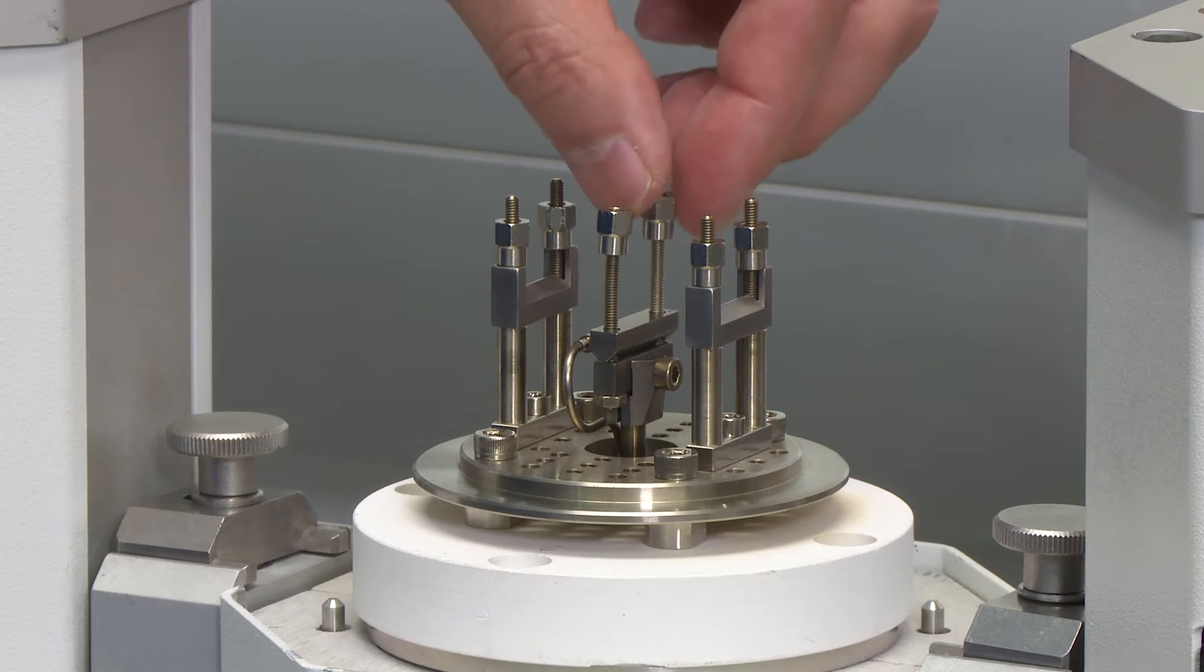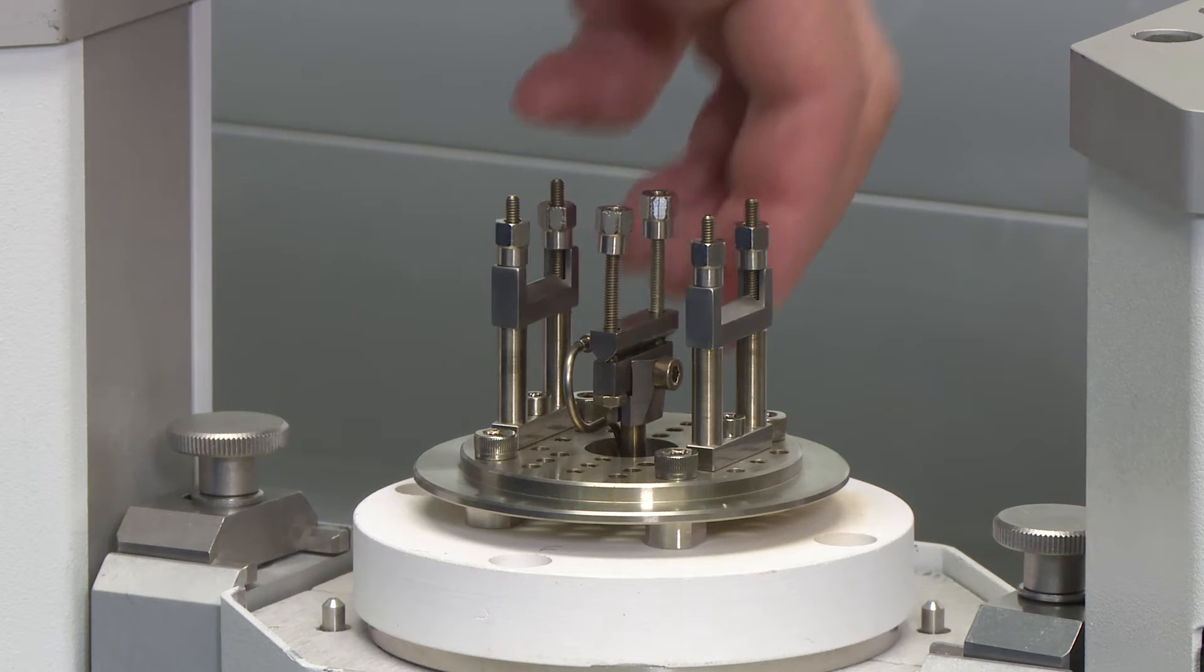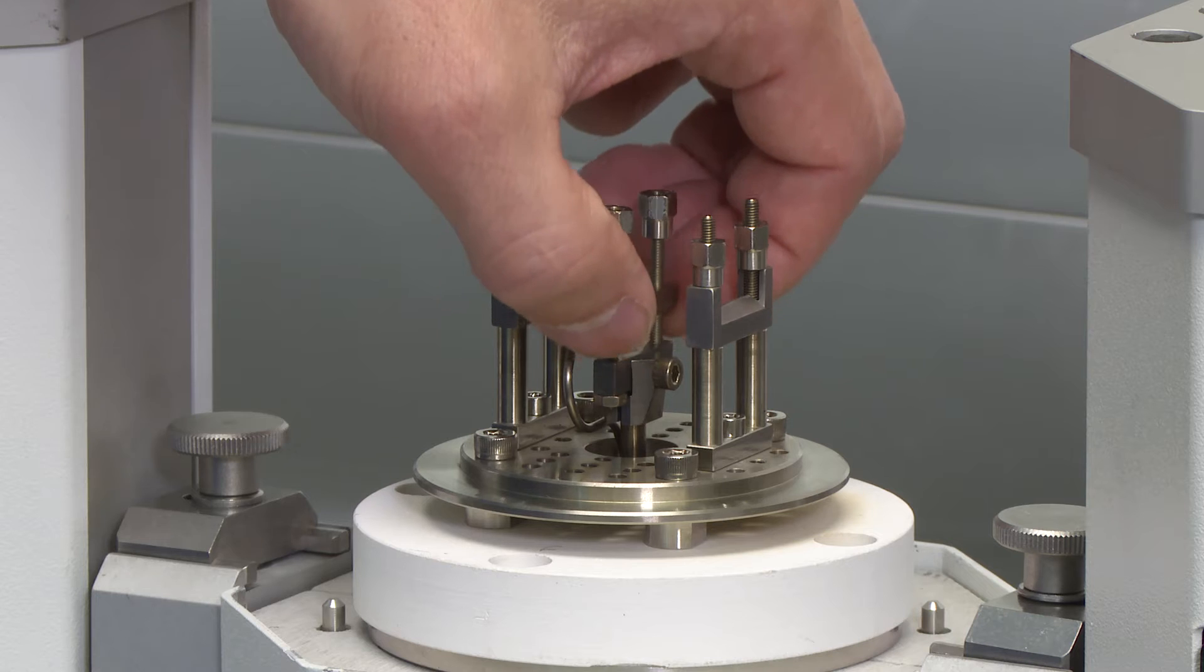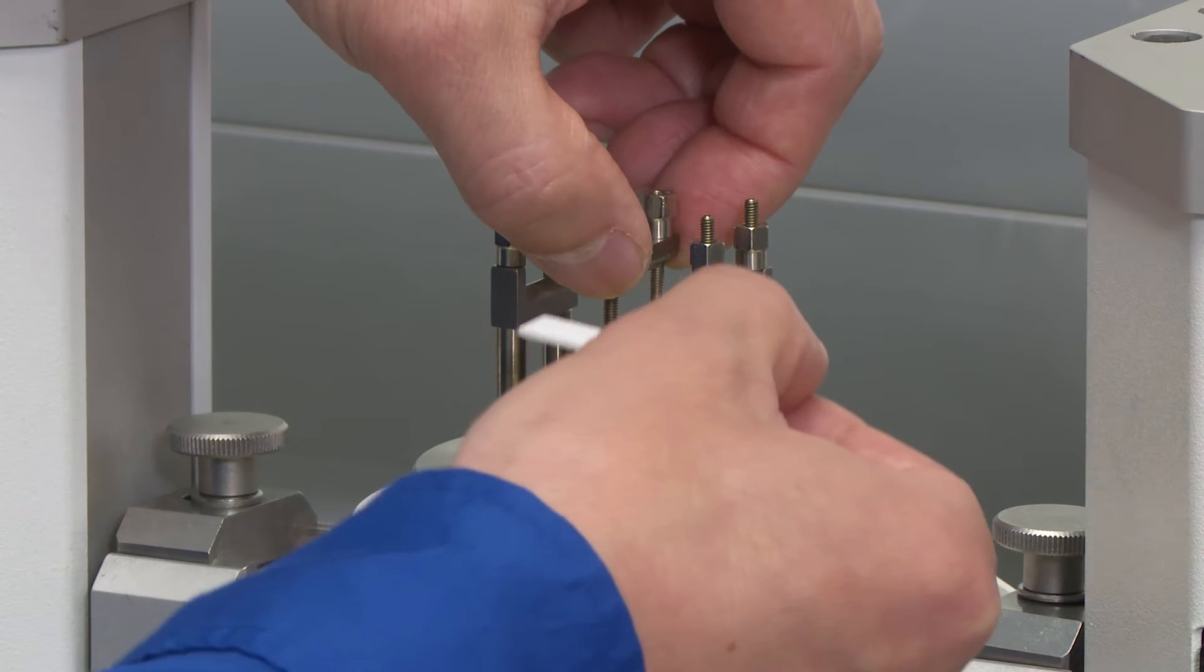After loosening these nuts, we can raise the center knife to slide the sample in.